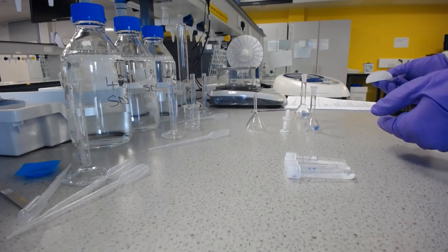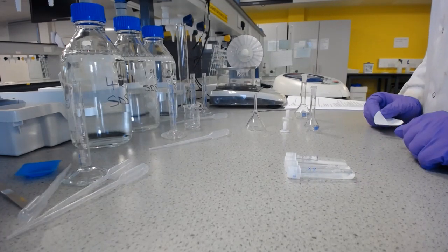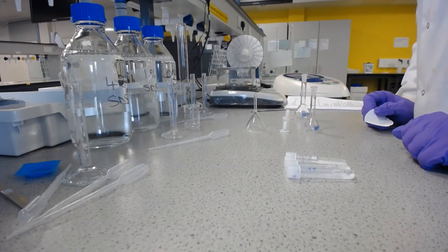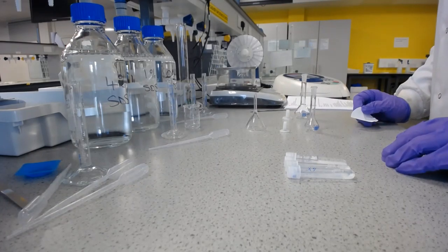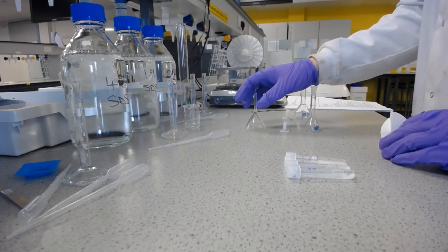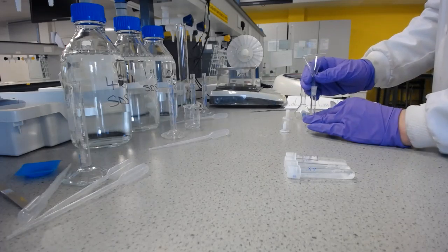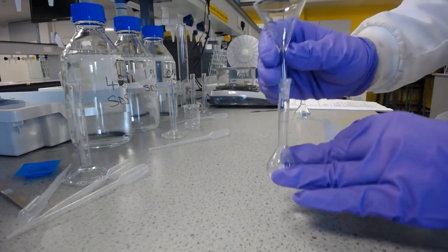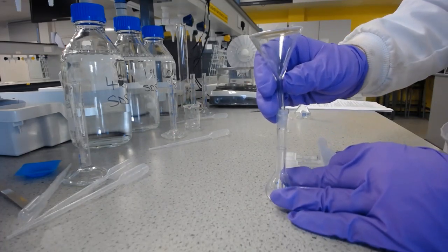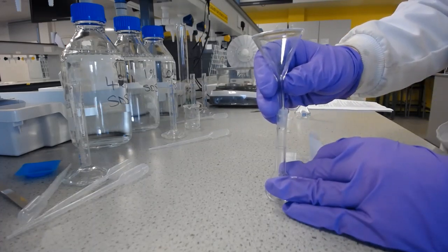So following your scripts, what we're going to do now is filter off all the excess aspirin, and we're going to do 2 dilutions so we get that concentration down into the area that our calibration was in, just to be sure of it. And so the way we're going to do that is we're going to take a glass funnel, and that will go into a volumetric flask, the first one. I'll do this closer to the camera. And then we'll put a cone of filter paper in the top and just pour it through and let it all drain through.